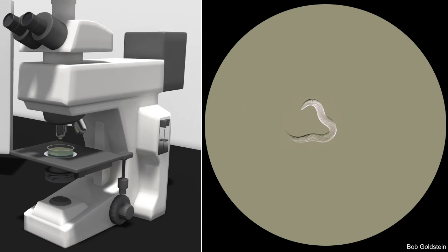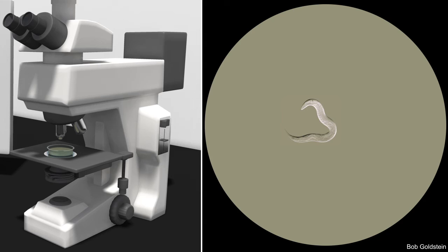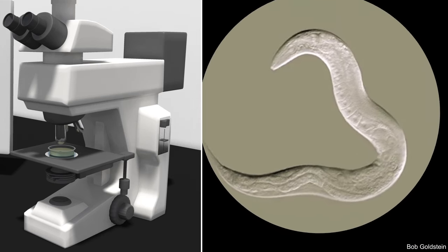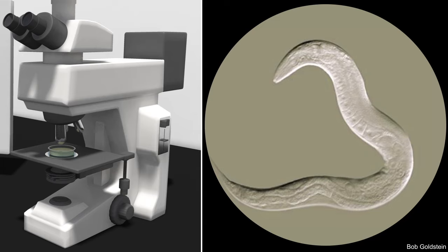When the researcher is using a 4x objective, the image is 4 times larger than when it's normally viewed at this distance. When the objective is changed to a 20x objective, the image is now 20 times larger than when it's normally viewed at this distance.